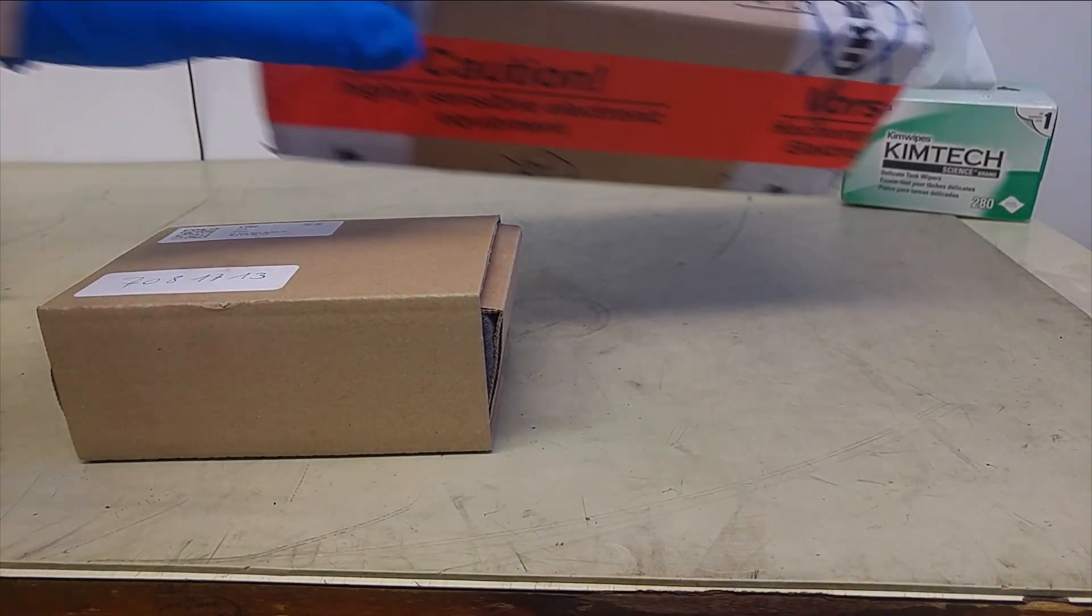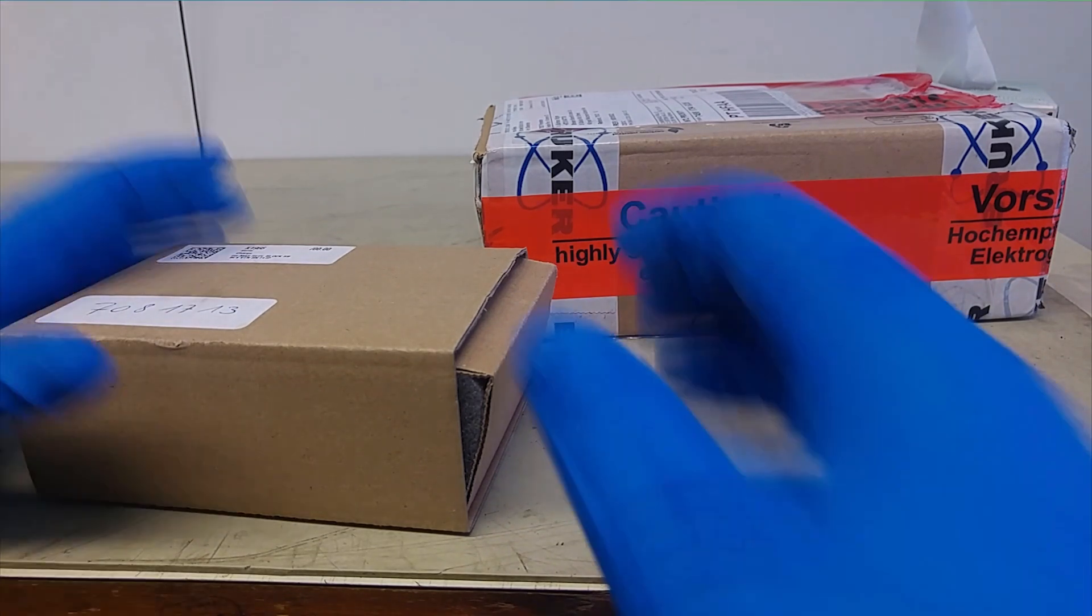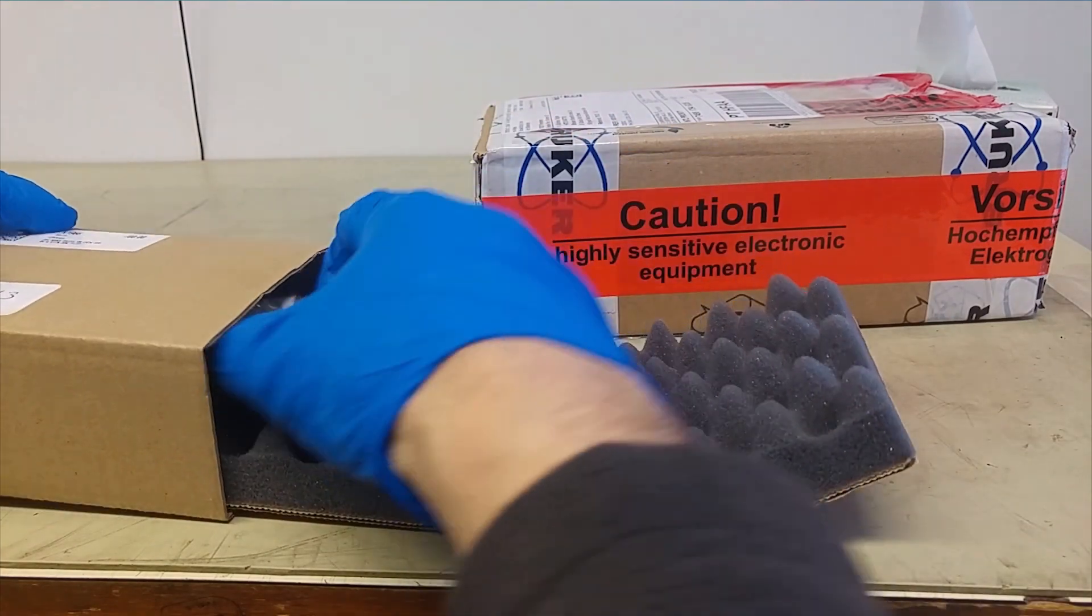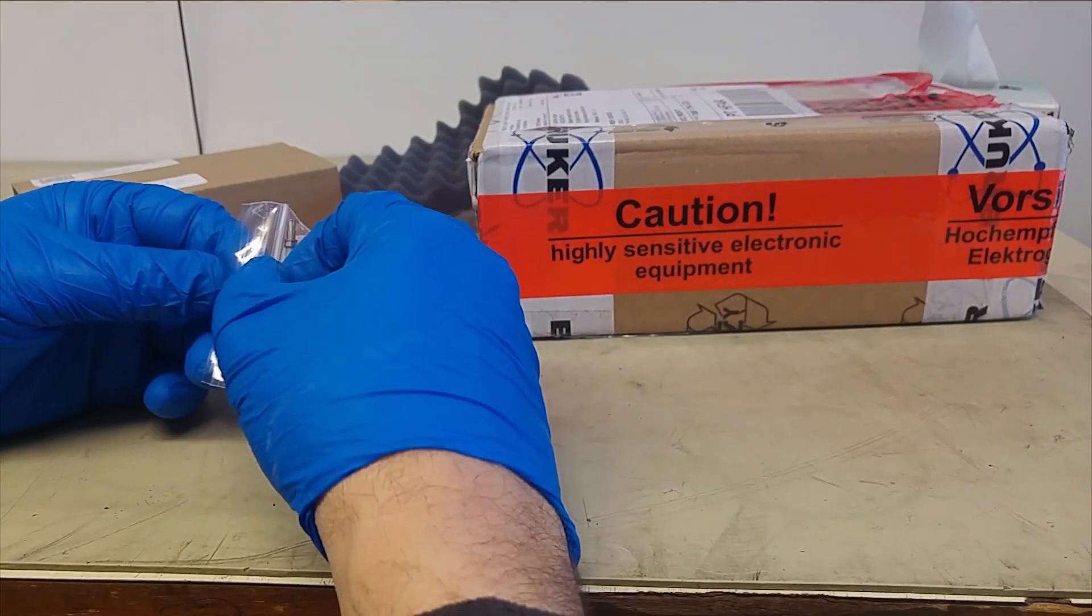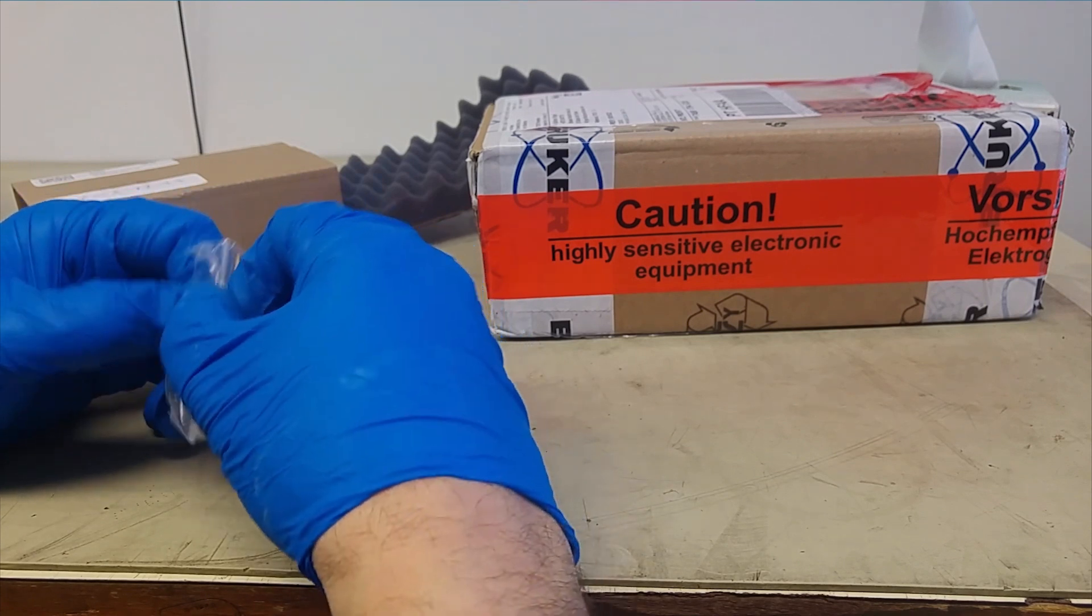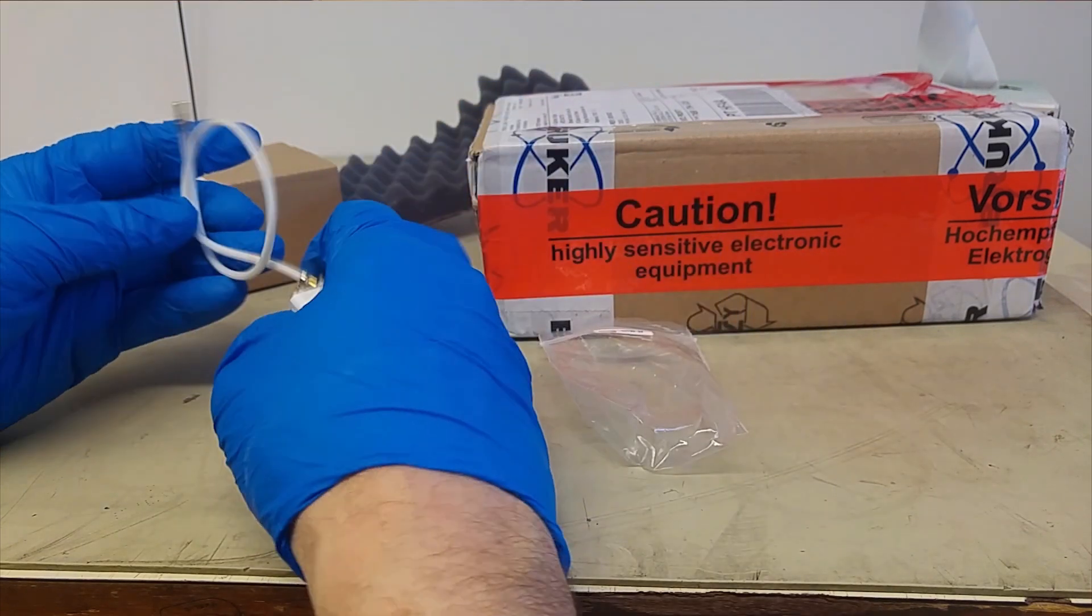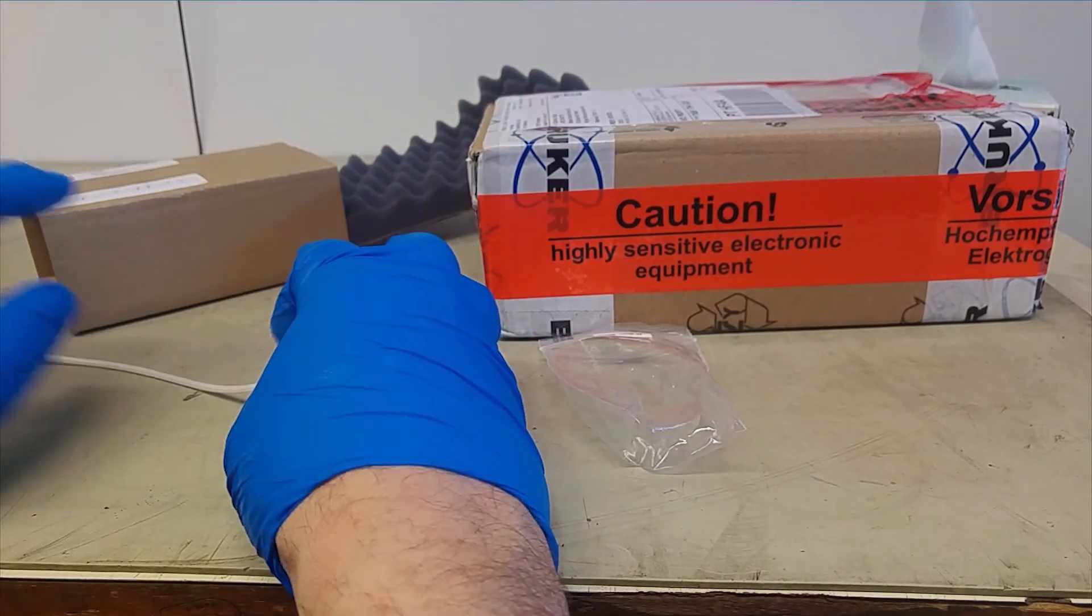The coil and the stator come in two different packages, so we'll start with the stator. I'm using gloves here to reduce the possibility of contamination. I don't know whether we're going to use it for anything like proton detection but the lipids on the skin can show up in magic angle conditions.